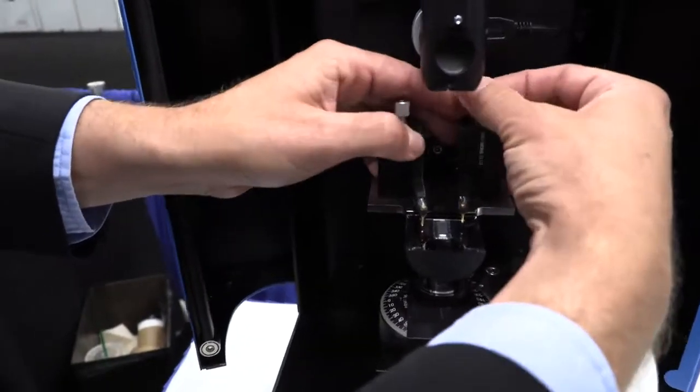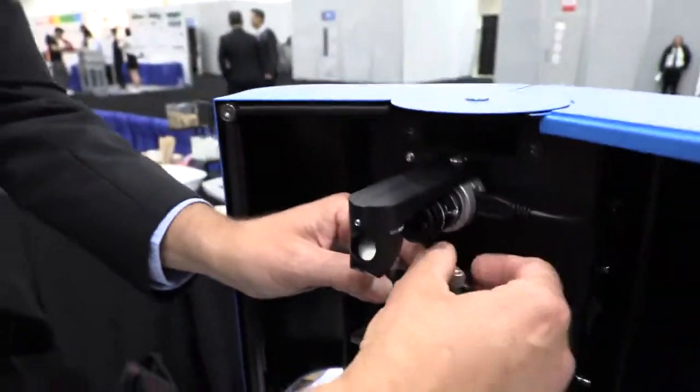So who would be using this? We have customers in the OLED industry, the big players from Korea, in Japan, in China, and everywhere in the world. So how do they put their samples in there or something? They have to make them in their own labs.